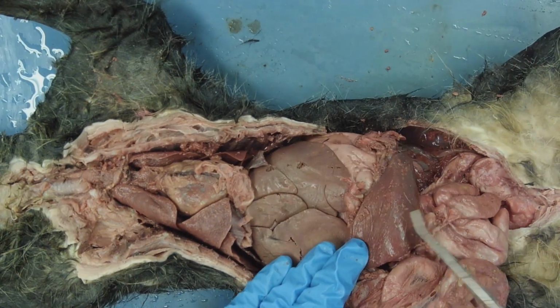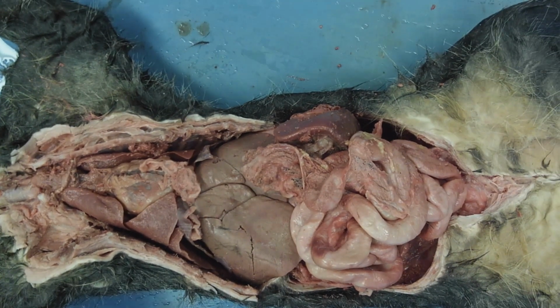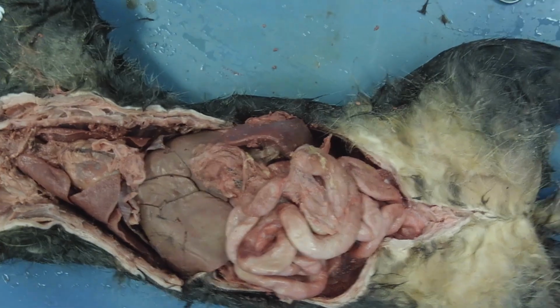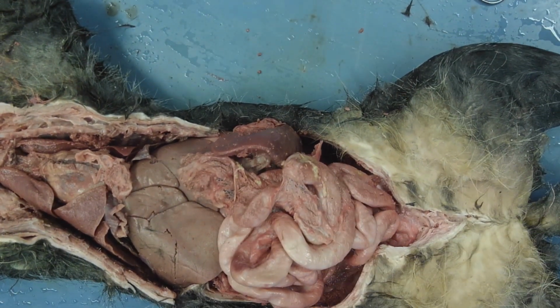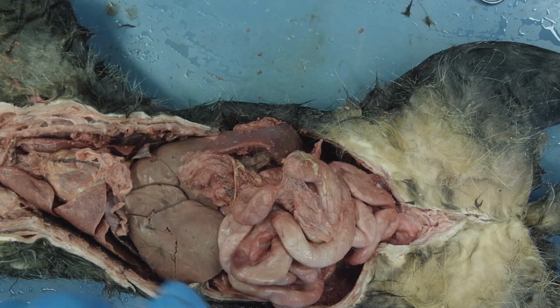part of the animal. Here we have the spleen. And then as we work our way caudally, we would get to the anus, which is the end of the digestive tract. The only thing I didn't show you here is the cecum, which I wasn't able to find while everything was inside the animal. However, once we remove it, and if you look at those pictures, you will be able to see the cecum in the cat.